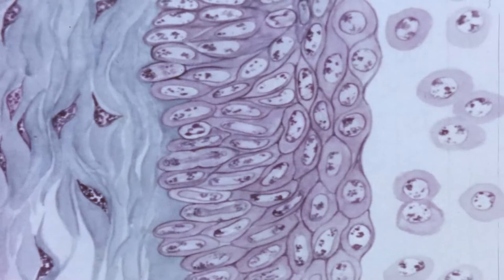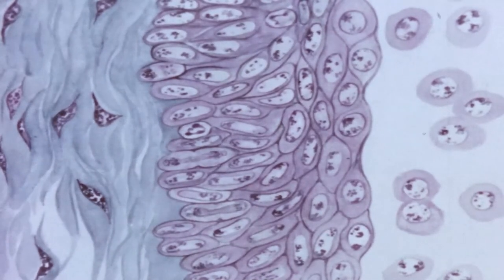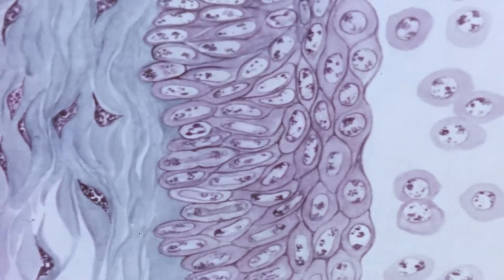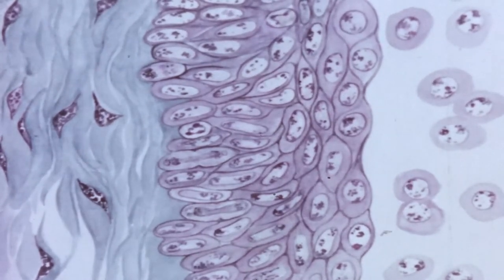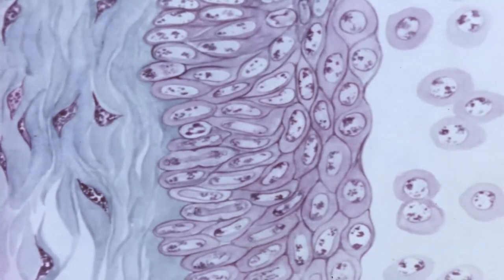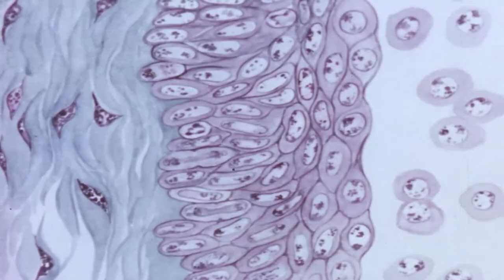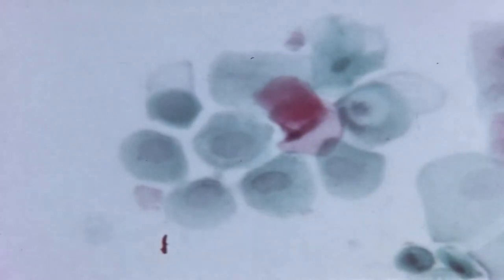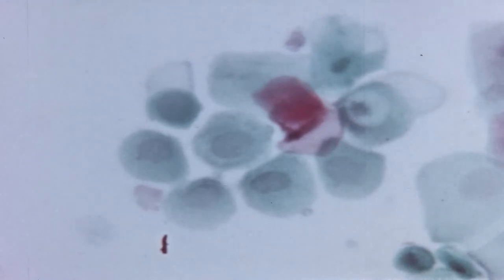A section of the vagina examined on day three of the four-day cycle shows an increase in the number of layers of epithelial cells. Leukocytes are no longer passing through the epithelium, and the superficial epithelial cells are still nucleated. In an actual smear made at this time, only nucleated cells are present.